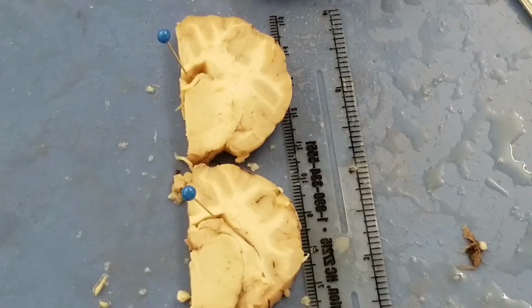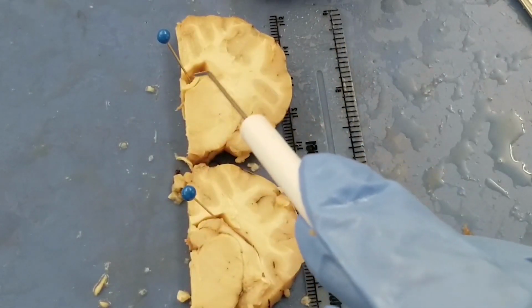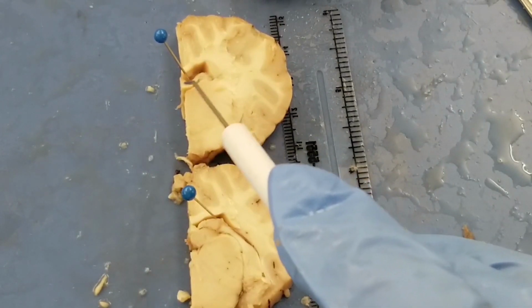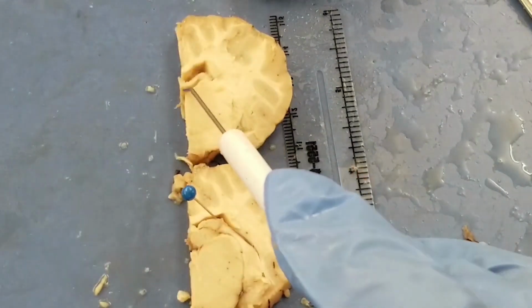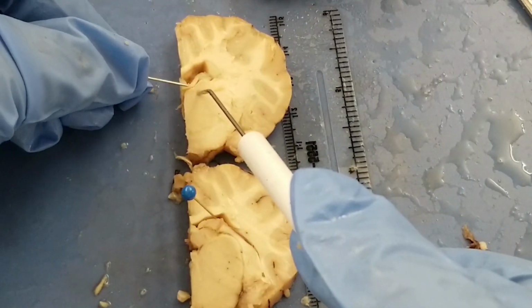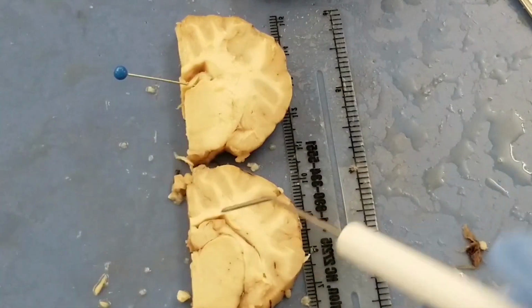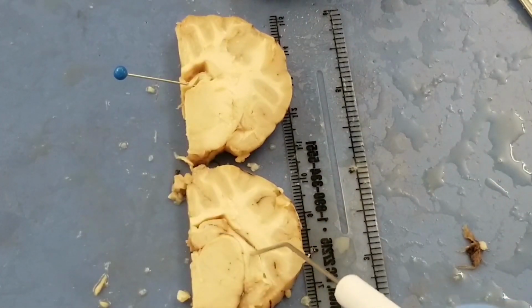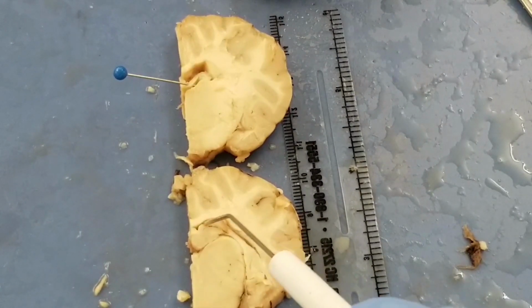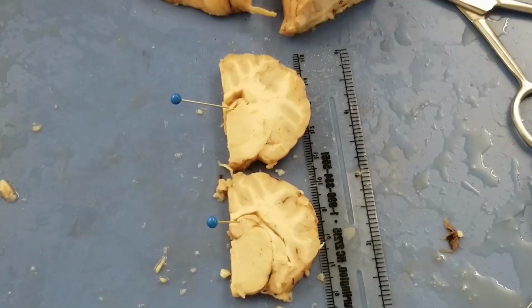Next one, hippocampus. So hippocampus is a really long structure, but on this plate, you only see one piece of that. So that's the hippocampus. I'm gonna pin that. It's the hippocampus. On this one, you see a bigger hippocampus. So from here, go all the way around here. See that? You can separate them out. So that's a very distinct structure by itself. That is the hippocampus.